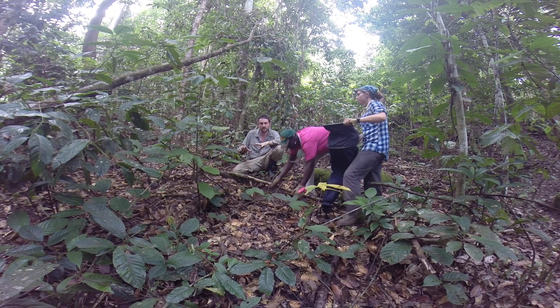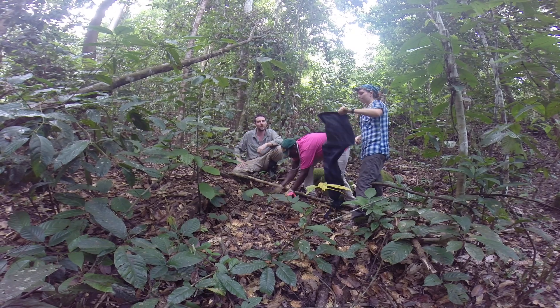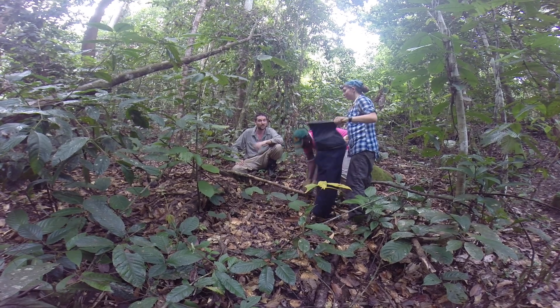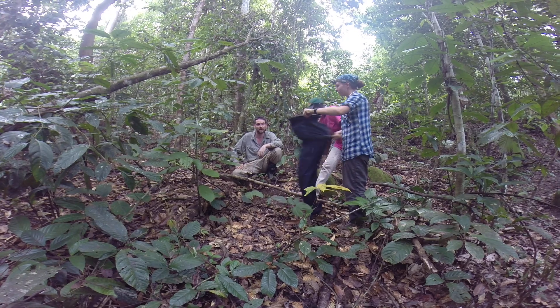We're going to break a few logs, or just sample at the base of them, to get a lot of ants. We really expect to get a lot of ants with this technique. Here in Borneo we can expect to probably get around 30 to 40 species in just one Winkler bag — it's a very amazing technique to collect a lot of species.